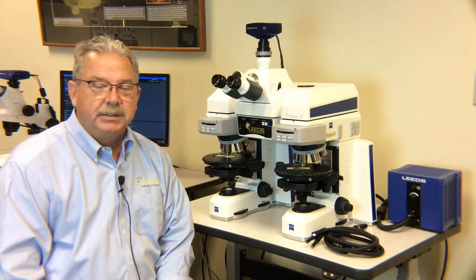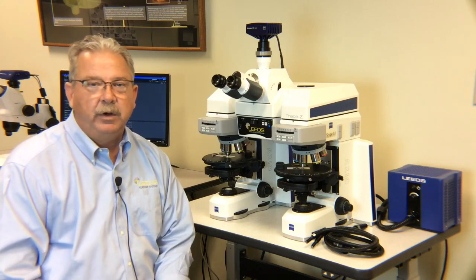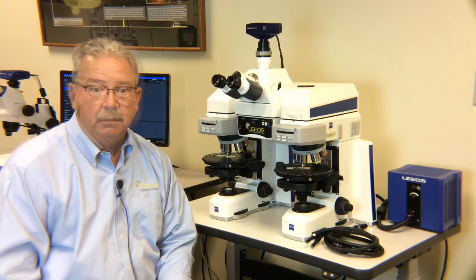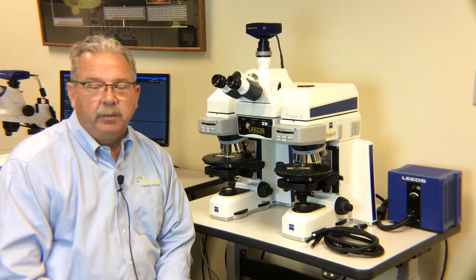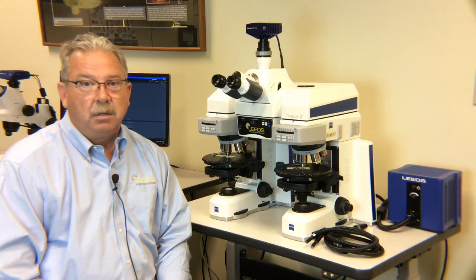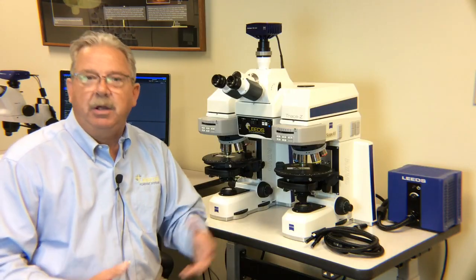The trace evidence examiner is going to compare oddities found at the crime scene. It's kind of an unusual word. What is found at the crime scene is going to vary from one crime scene to another. In one case, I might be comparing carpet fibers. Maybe they were from the trunk of a car they thought the victim was placed in. In another case, maybe they found long blonde hairs on the victim. It might be soil, it could be plant material, it could be almost anything.